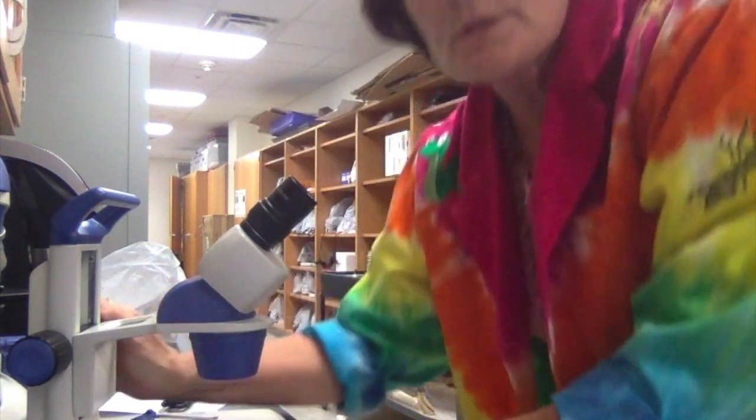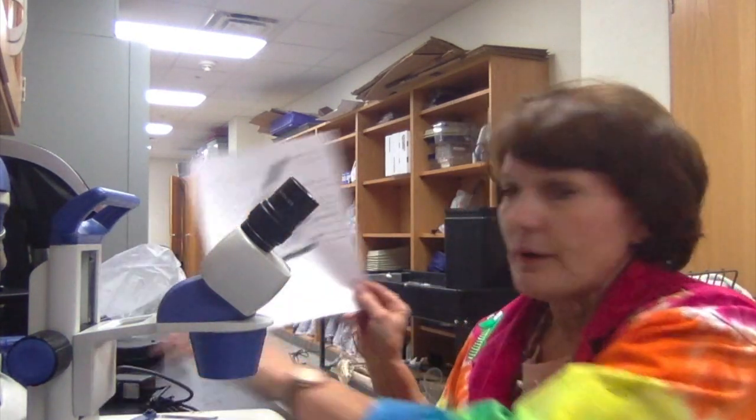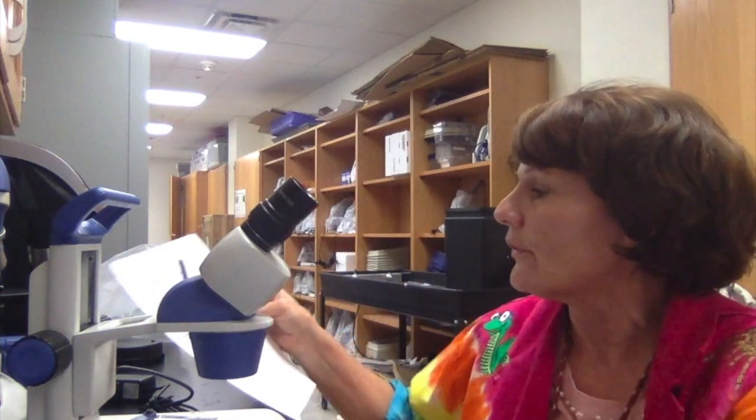This one is generally used to look at things that are more dimensional. They're not flat. They're not a single layer of cells. So maybe something that I'm dissecting. If I wanted to look at maybe frog eggs and put them underneath here, I can put them under here, and I see them in dimension. It gives you a 3D view of them. So this is a dissecting microscope, binocular microscope. The other one is a monocular, mono 1, binocular 2 eyepieces. So if you have got your paper, you want to get this one filled out so that you have all the parts labeled.